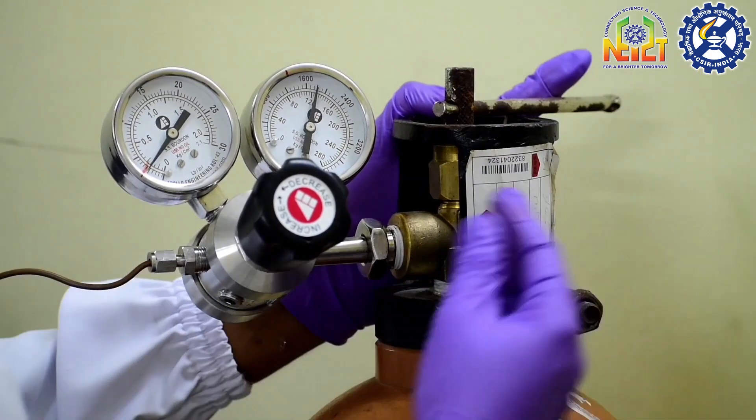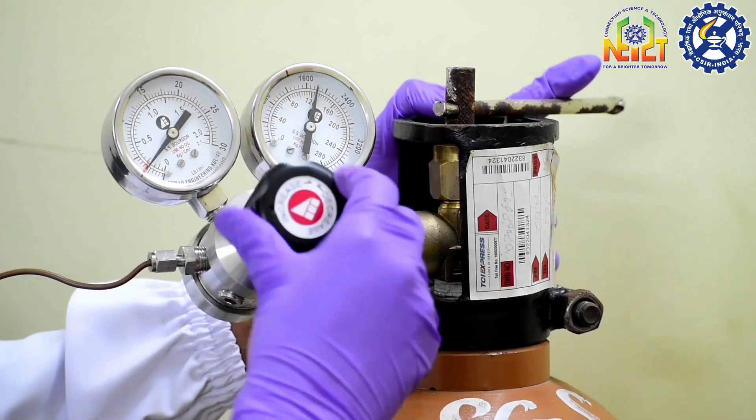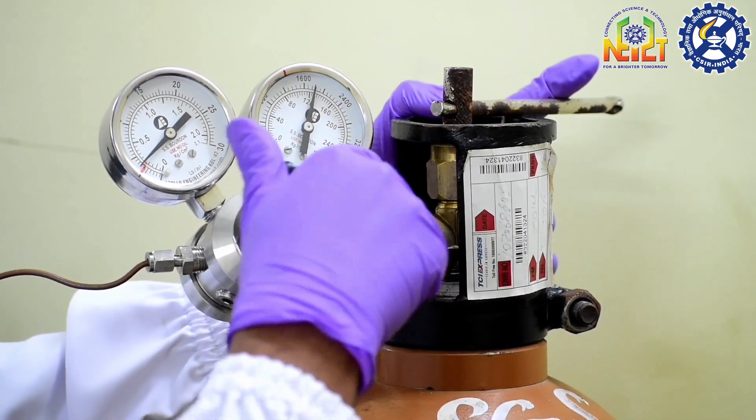For analysis we have to open the gas cylinders. We basically use helium and nitrogen gas cylinders.